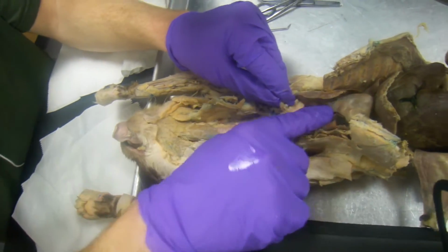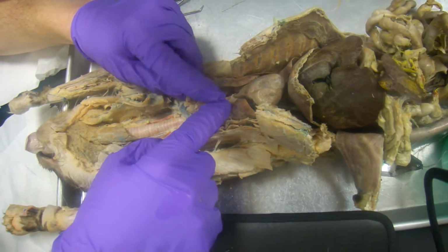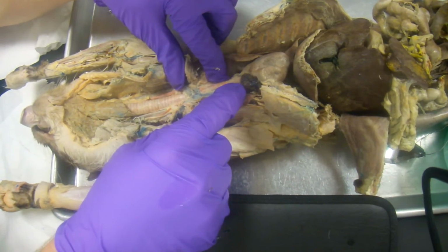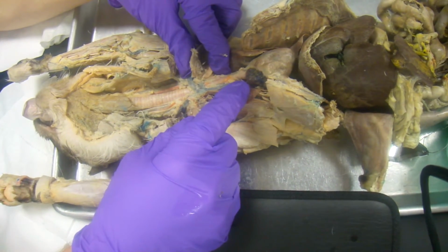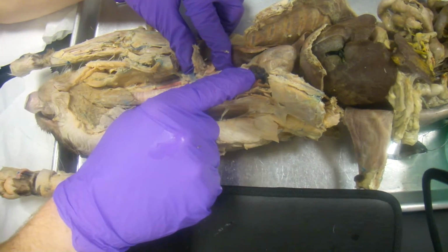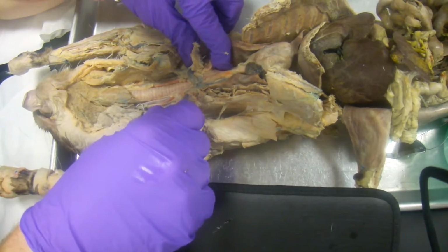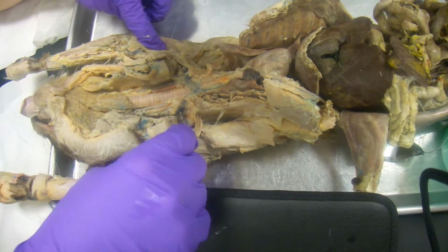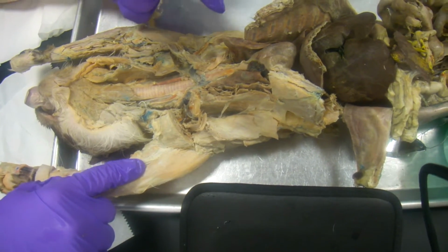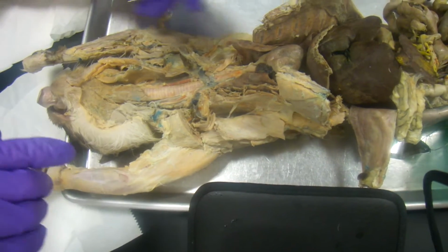And then also going back here again, back to the ascending aorta. There's also on this arch comes off the subclavian by itself. What's this called again? Ascending aorta. Yeah, ascending aorta, and then subclavian is separate by itself, and that continues the same way it continues over here. Subclavian, axillary, brachial, radial, then ulnar. And that's how that works.